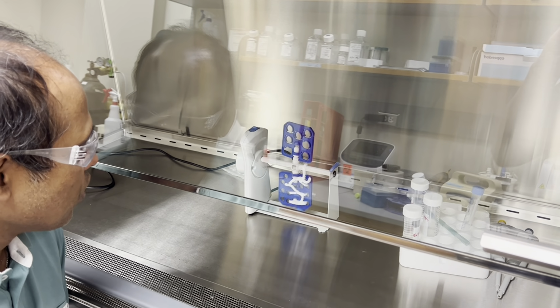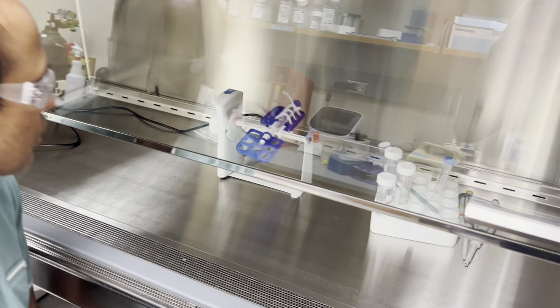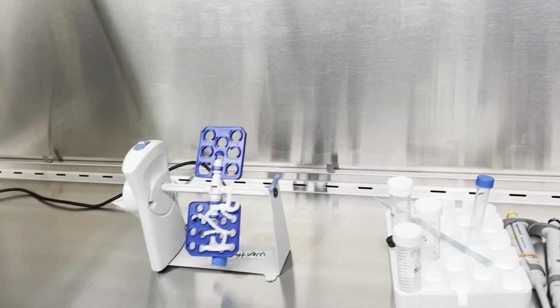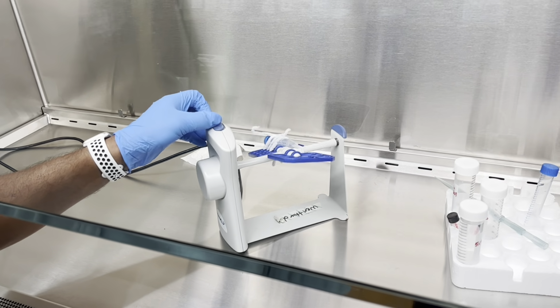So let it be done. 2.5 hours, you said? Yeah. It's 2:40 right now, approximately. So, is there a specific speed? Can you even make this faster or slower? The rotation speed? I don't know. Is this fine, the way it is? Yeah, this is fine.